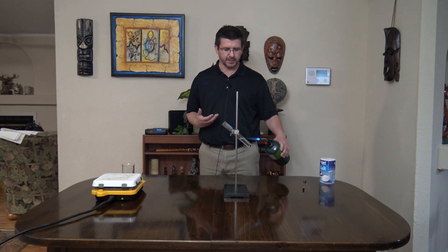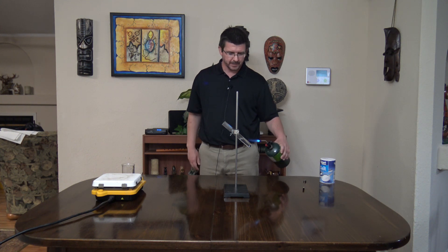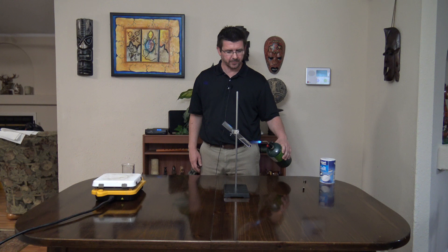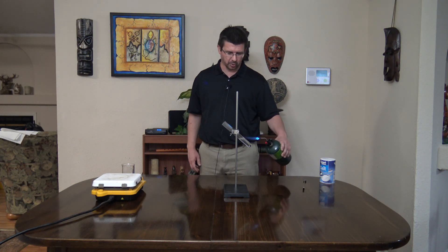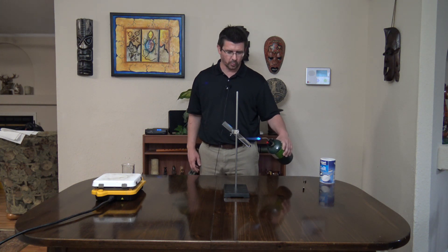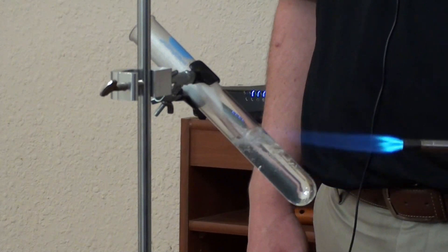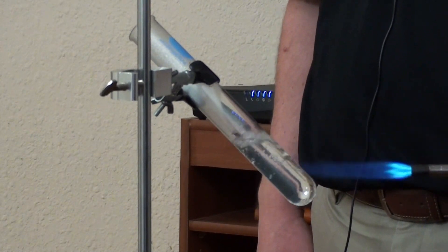We know that when we boil water, it turns into steam, which is not a new substance — that's just the gaseous form of water. As that gas escapes out, it's going to leave the salt behind because the salt has a much, much higher melting and boiling point than the water does. We're just going to allow this to go for a couple of minutes and then we'll look and see what's left behind.